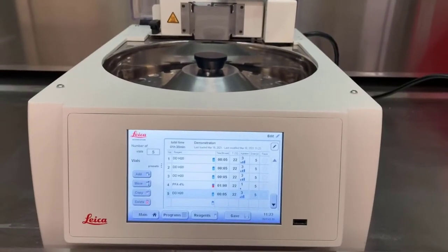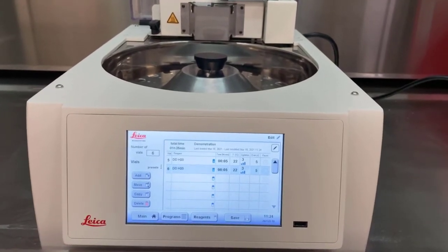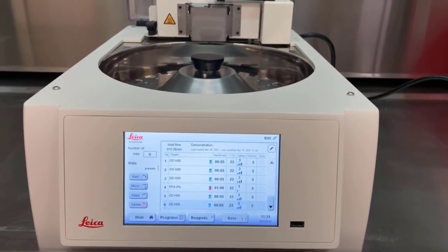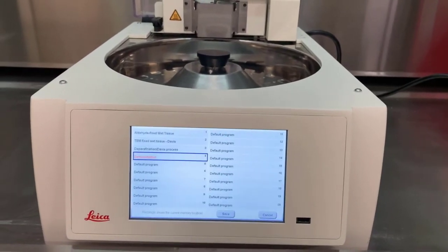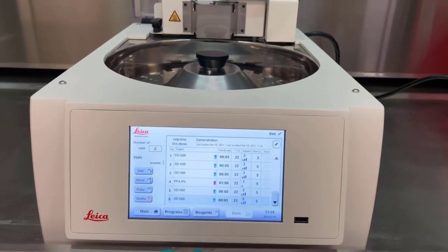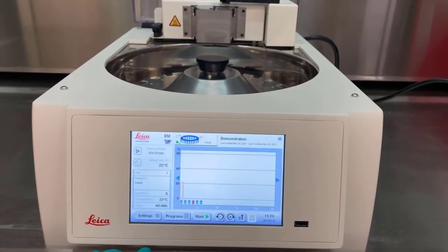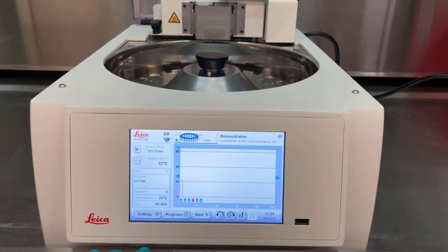With numerous steps prepared in this demonstration program, it might be appropriate to save the effort we've already done. The Save button near the lower right brings up a menu to select where you want the program to be saved. Be careful not to overwrite other programs. With this program complete, pressing Main brings back to the main window, where the characteristics of the program are now shown on the screen.